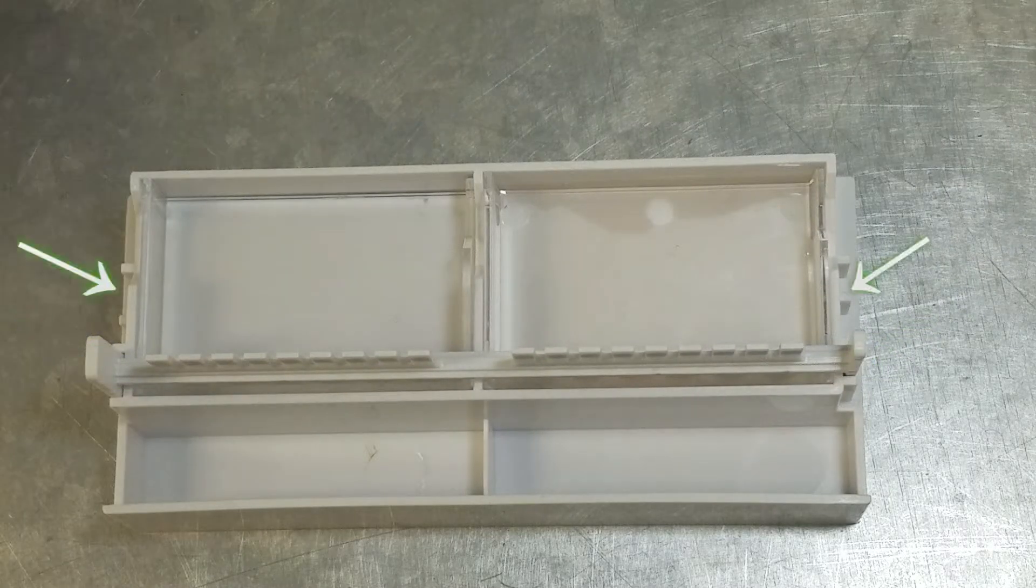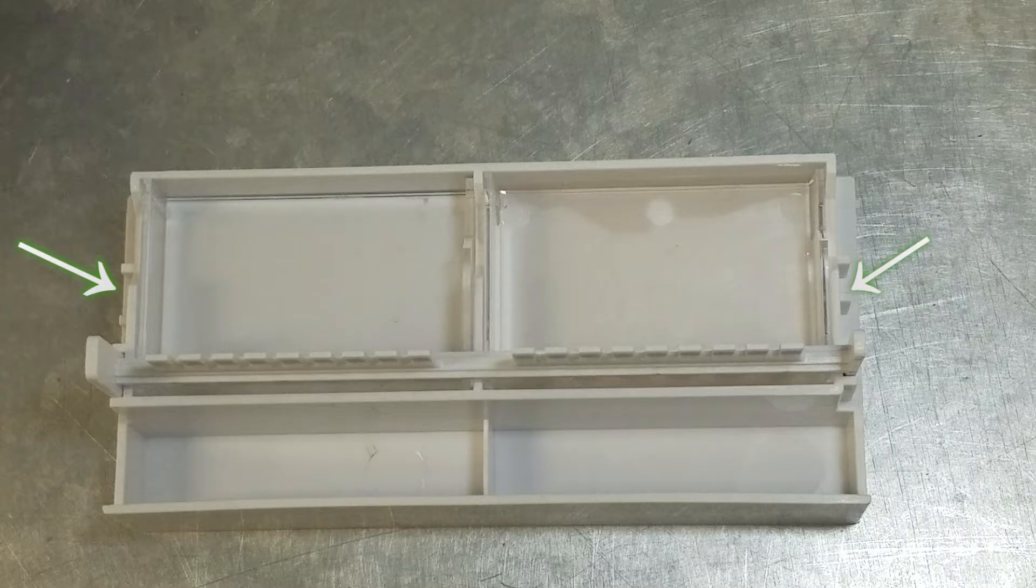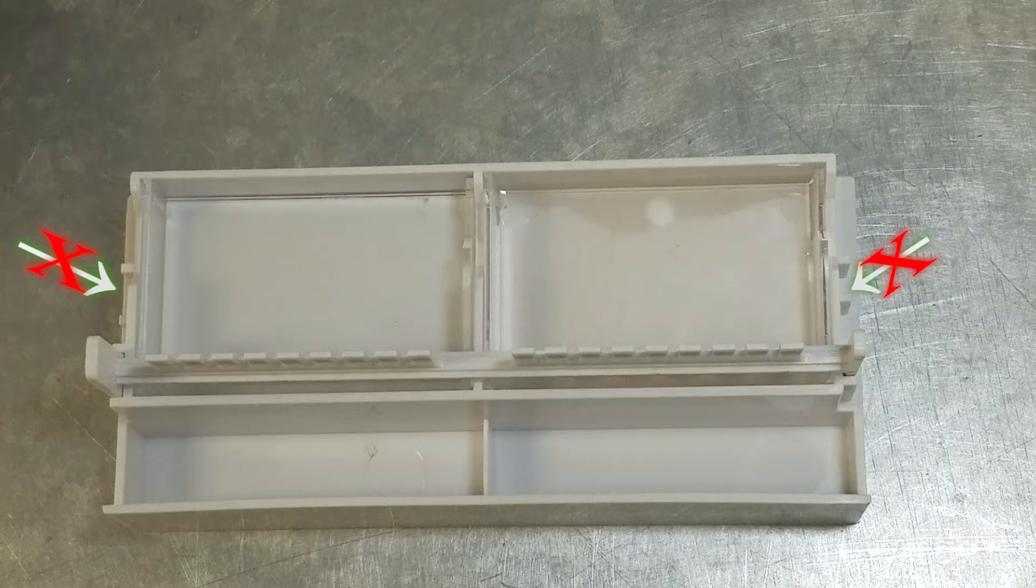There is a slot in the middle of the gel casting stand to insert the combs as well. This is used only for running electrophoresis with a dye kit, and should not be used for running DNA samples.